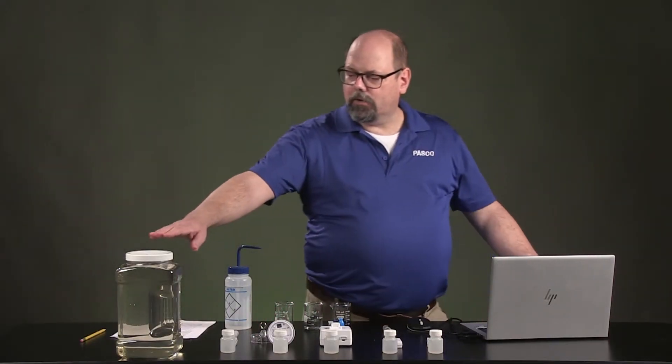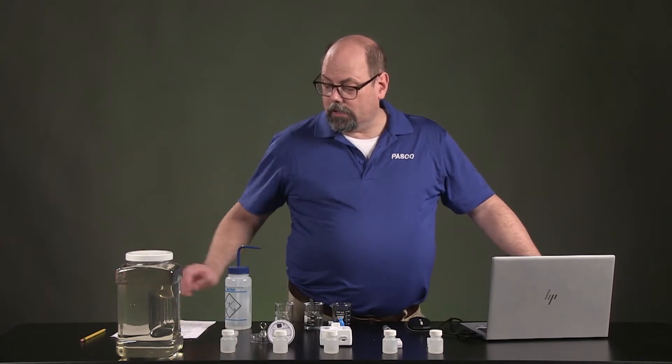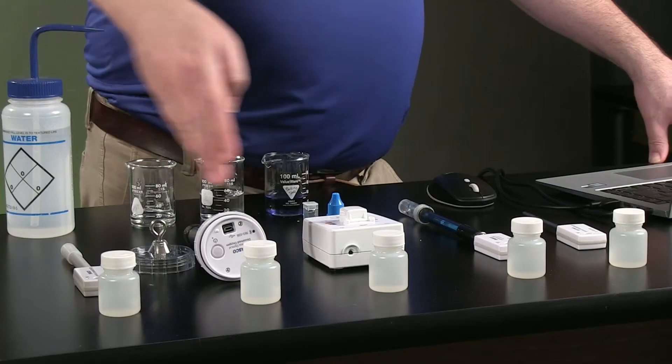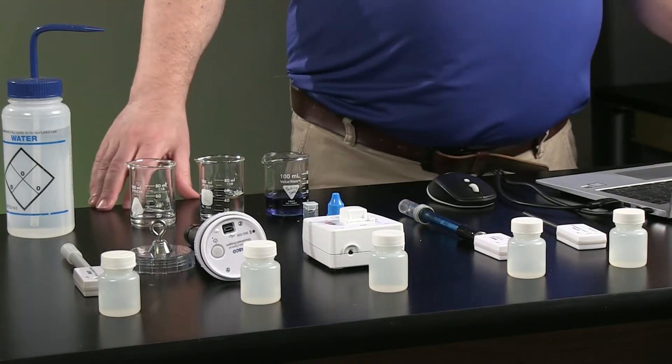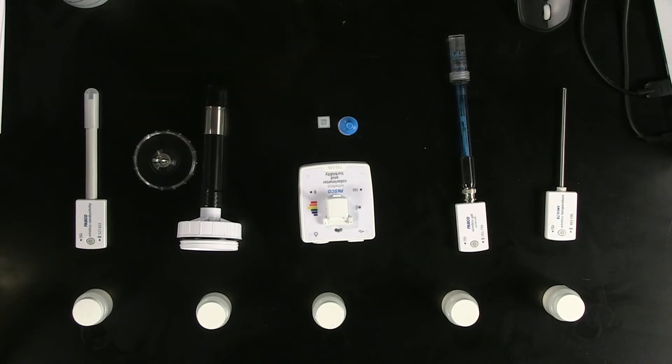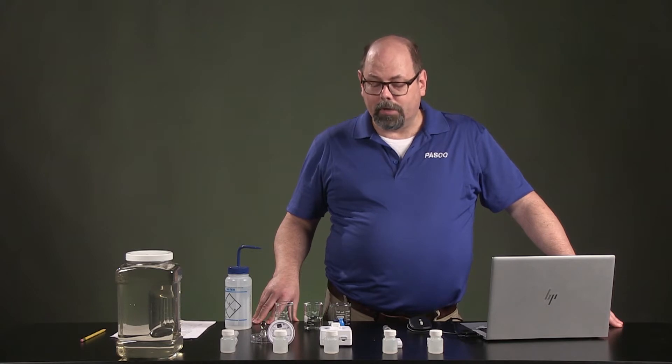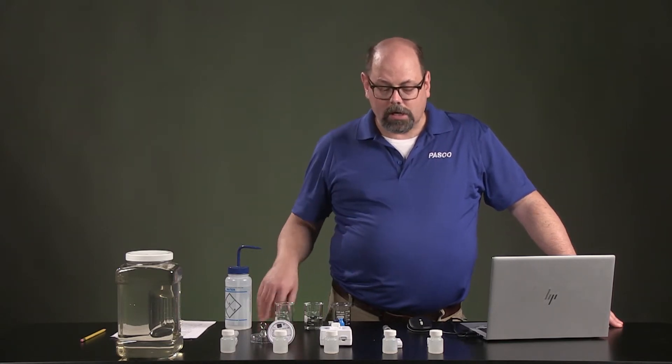As you can see, we've returned back from the creek. You can see the water quality here, the color and the clarity that's there. I've distributed those into some testing jars so that we can use these different instruments to test the quality. I want to take a second to talk about each one of them, and then we'll show you how you set up to standardize each of those, to put a reference to each of those.